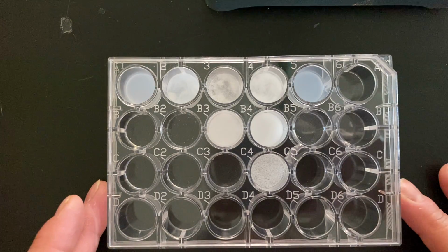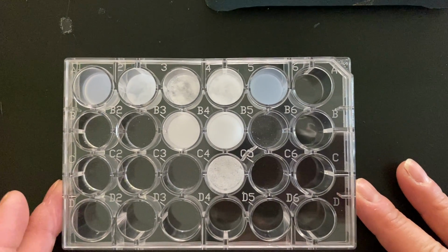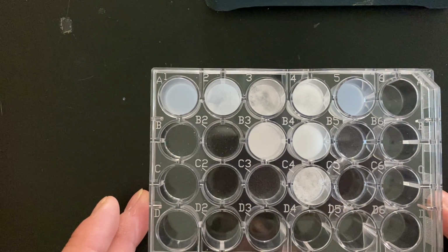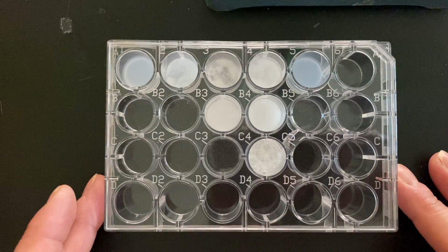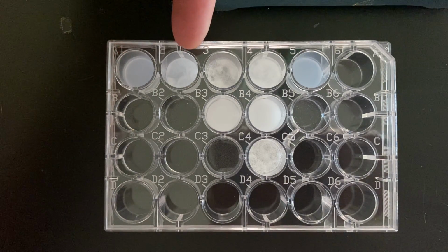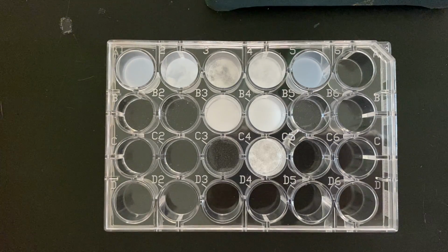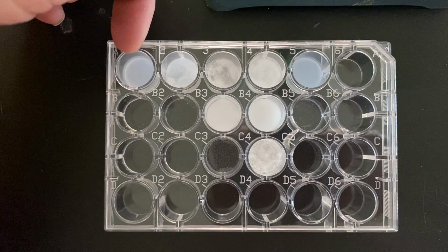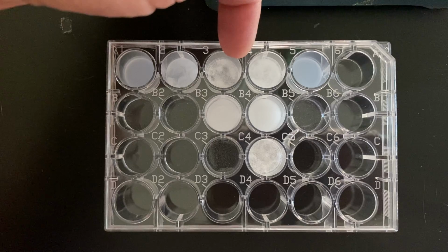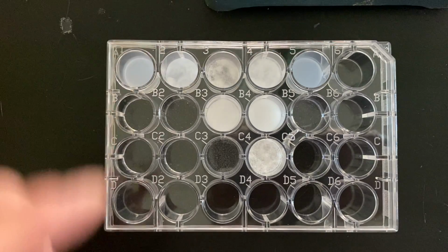Okay, so again, 2 things that you want to look for, and I'll move these around so you can see how much solid you have, whether or not you actually get a solid. So again, this is magnesium, this is calcium, this is strontium, this is barium, and then this is your unknown.